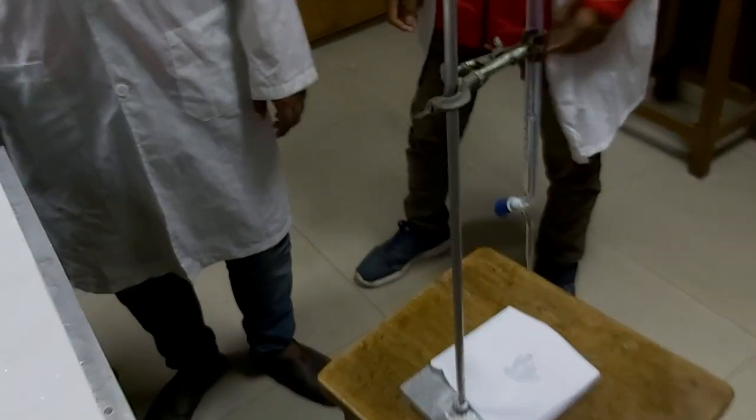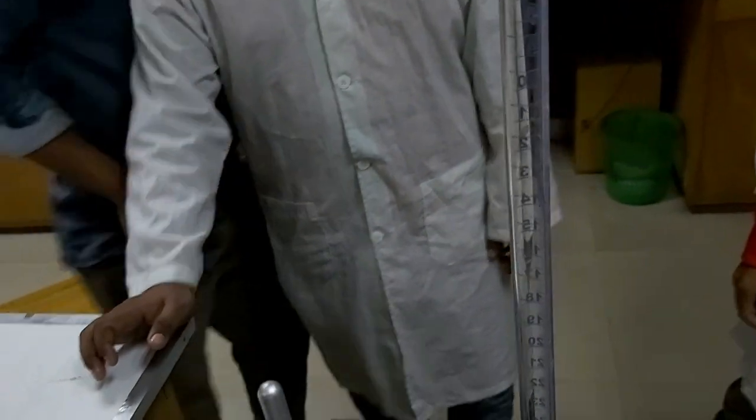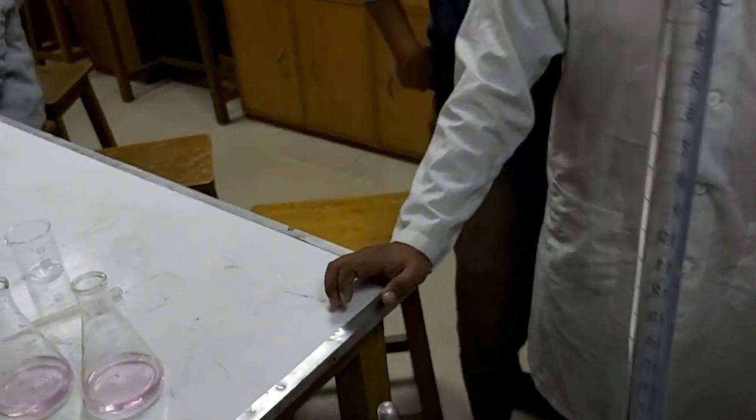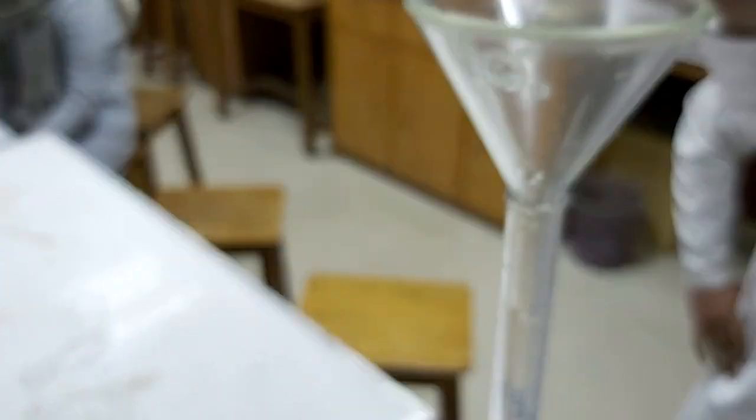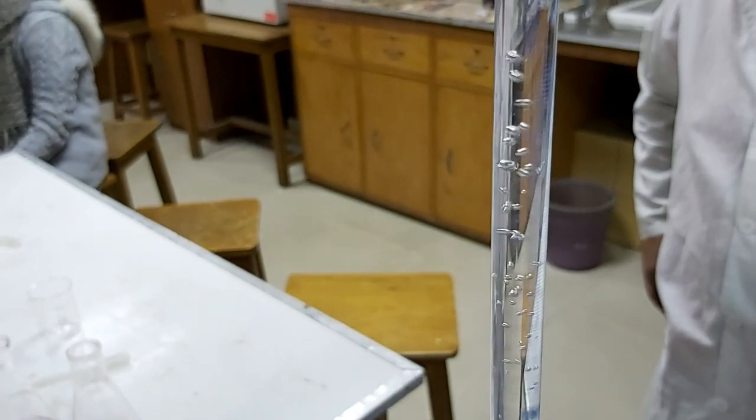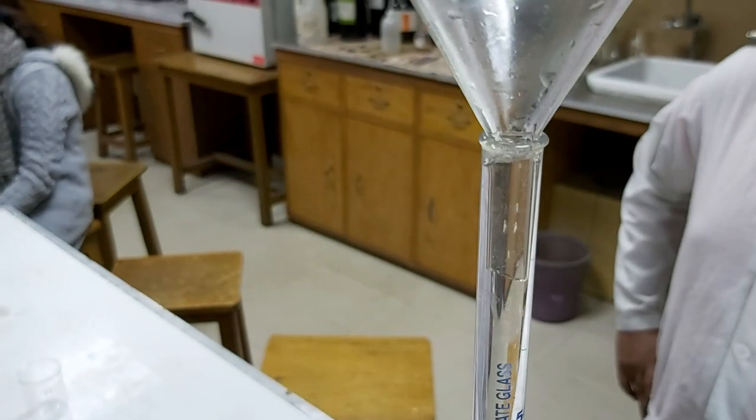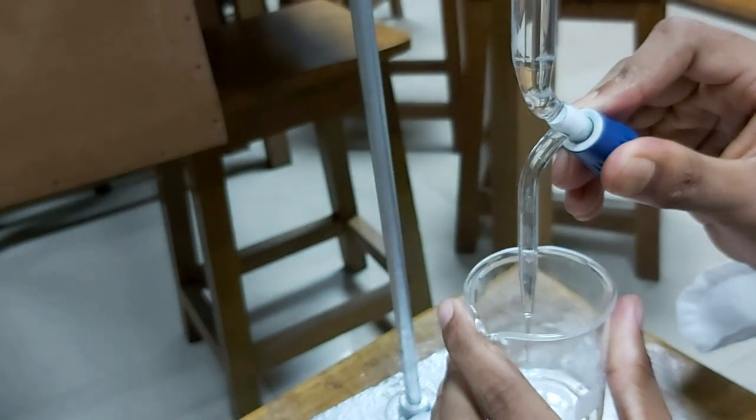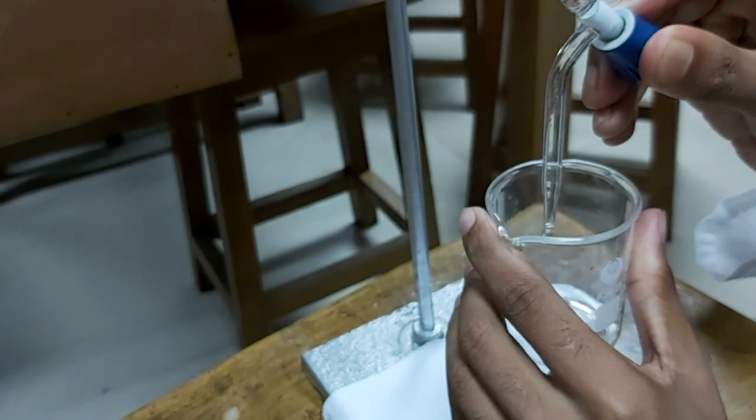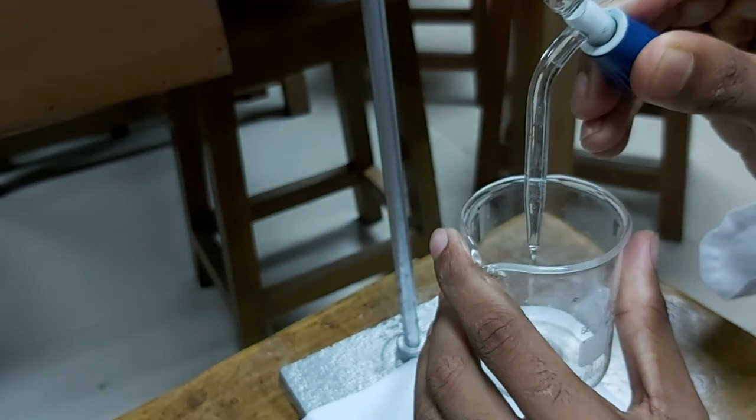Before performing another titration, we are going to refill this burette. Before filling the burette, we put a funnel, and with the help of this funnel, we fill it. We have taken an extra amount of solution, and he is now discarding that extra amount.